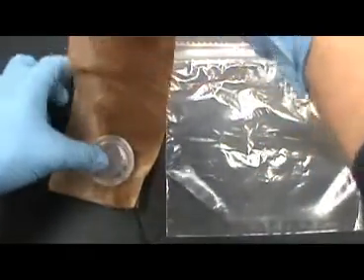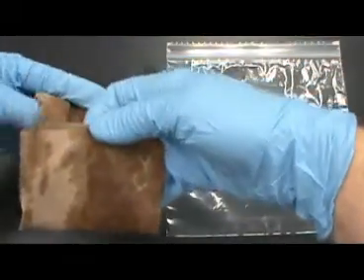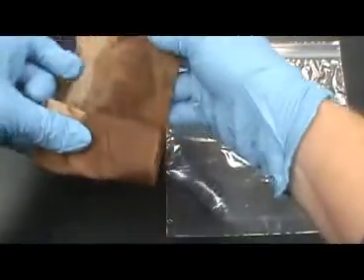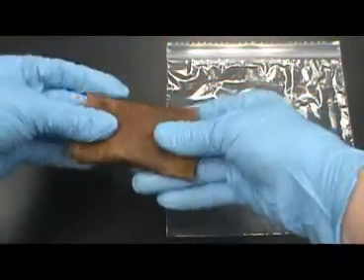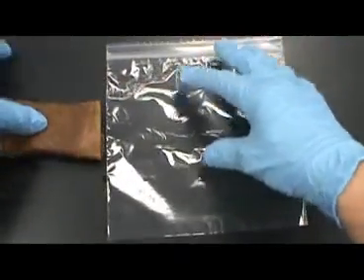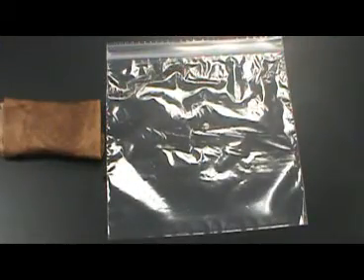Do not flip the titer plate upside down; always keep the plate lid side up to prevent spilling samples into the lid. You should also have a plastic bag that you can label with your group name.